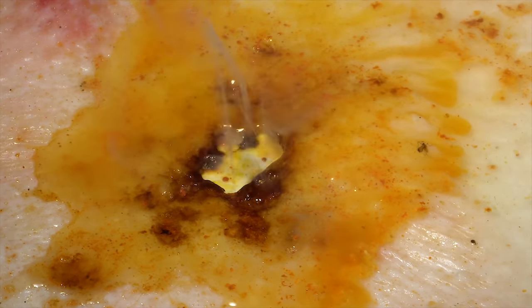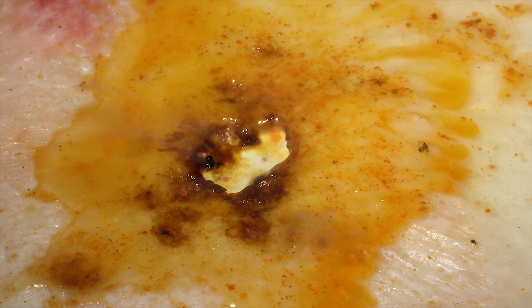For this reaction I used a piece of white phosphorus smaller than one gram.